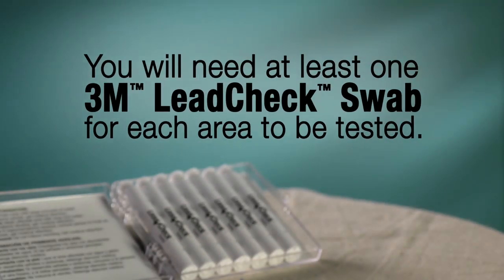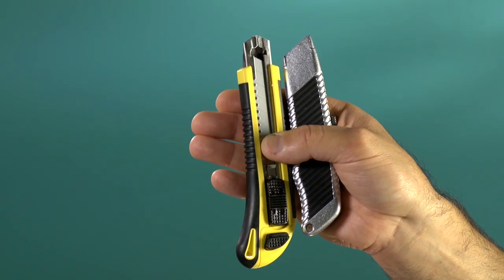Note, you will need a separate 3M Lead Check swab for each area to be directly tested. You will also need a sharp utility knife.